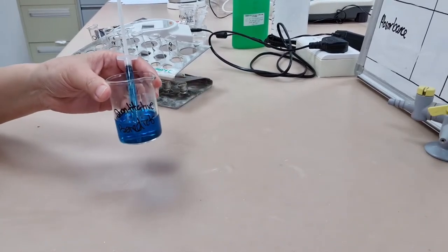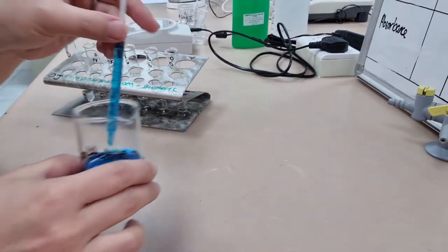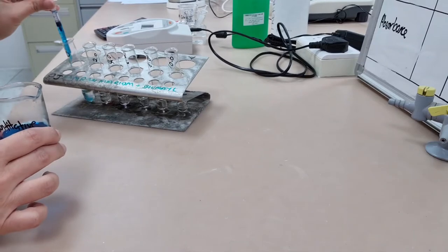This is required practical 11 where we use quantitative Benedict's reagent to find the concentration in an unknown sample of urine.